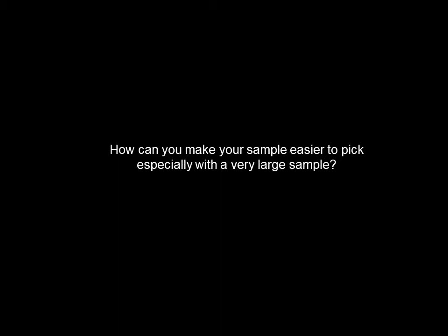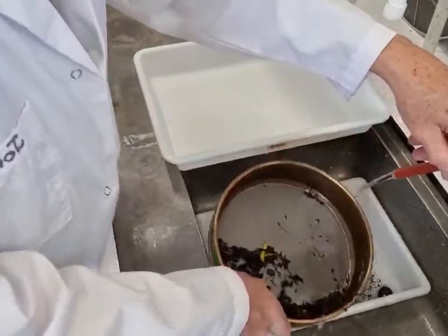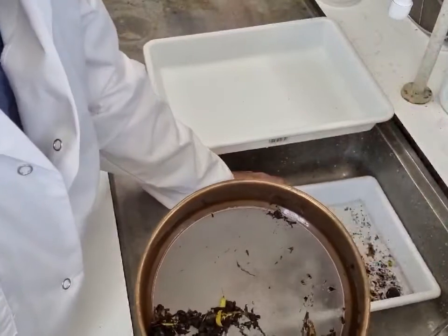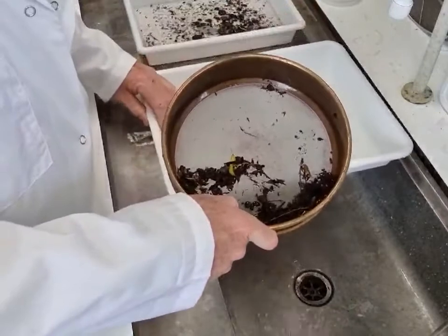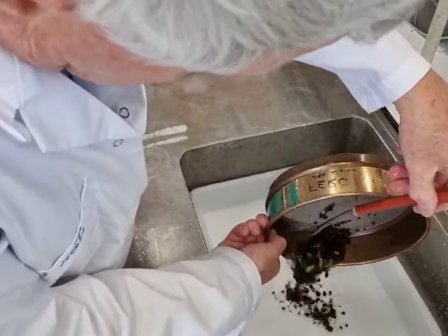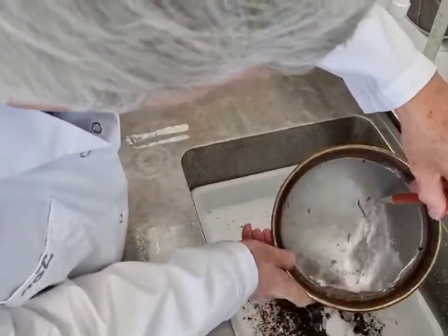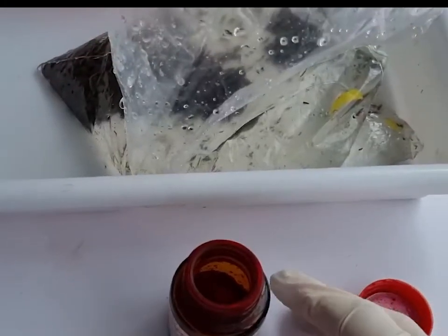You can see here I've basically washed it into a tray. Some samples will be messy and large — you might think you can't deal with all of this at once. One method I'm showing here is splitting the sample: I'm washing about half of it into one tray and the rest into a second tray, splitting it in two. This is really useful when you've got a lot of animals or a lot of fine material. Do make sure you clean your sieve very thoroughly.